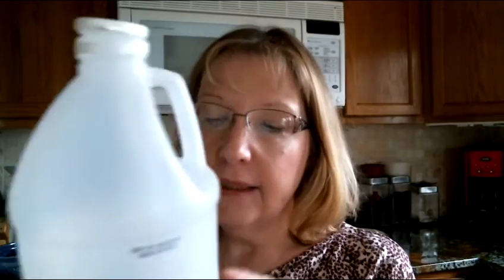5. To do the titration, you need to start with a vinegar. And on the label, you will see a place where it will say percent acid or percent acetic acid. Be sure to record that both as part of your hypothesis and in your materials section. As you can see, my bottle is about empty, so I am just going to pour a little bit of vinegar into another container, and I'm going to use the vinegar from here.